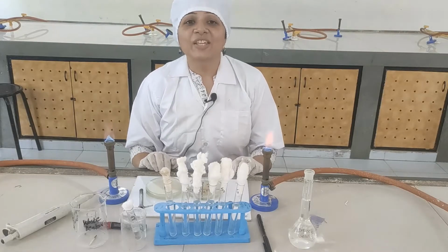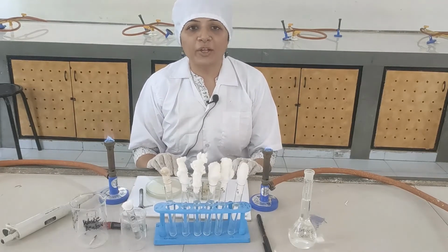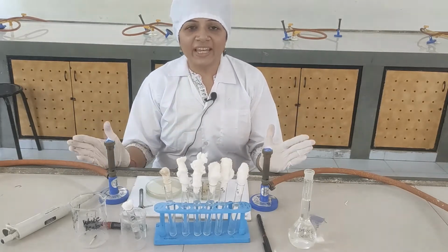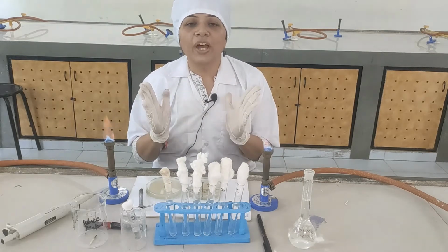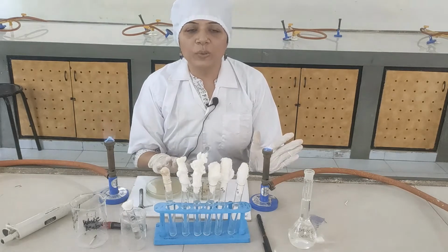Hello dear students, so now we will start with the practical demonstration of microbial assay by cup plate method. This is a working area, an aseptic area between the burner in which you have to work. So let me introduce you to all the requirements which you will need.